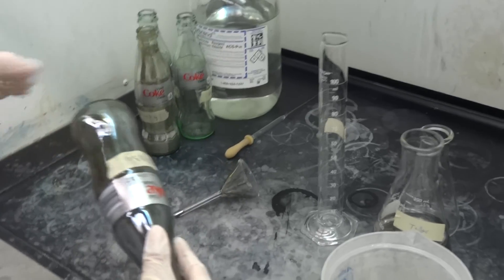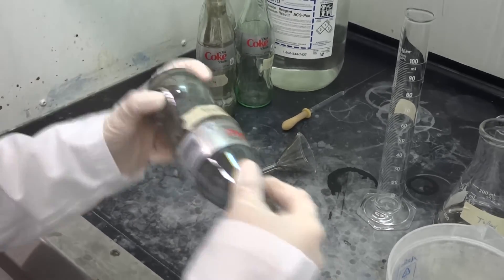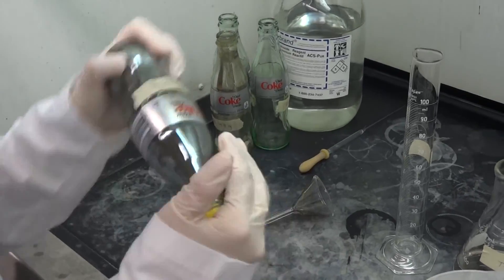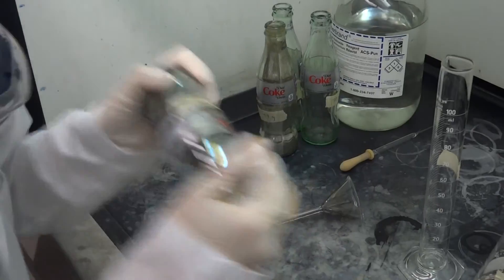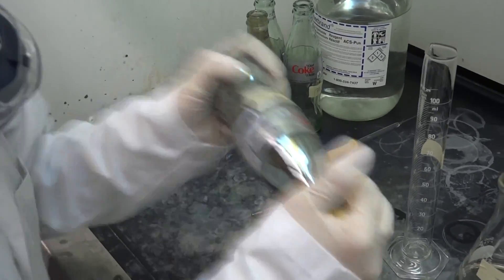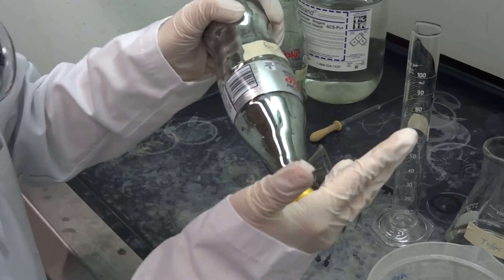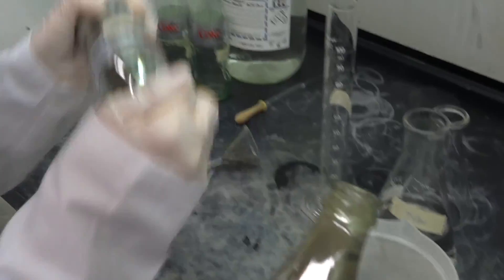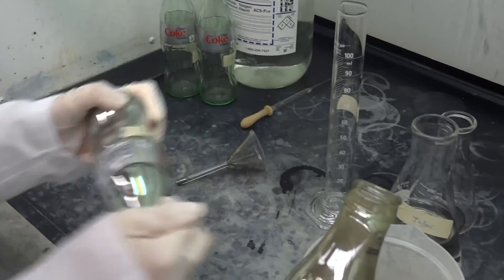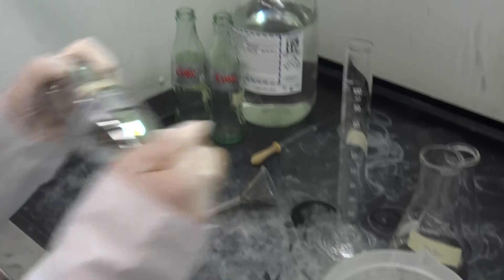We're starting to see the silver now — the mirror forming. There's a lot more silver than the other one, though, because they're shaking it vigorously. Maybe it's because we got the concentrations better, or maybe she didn't get the outside as dirty. But yeah, that one does look a lot better. Well, that's just the test one.